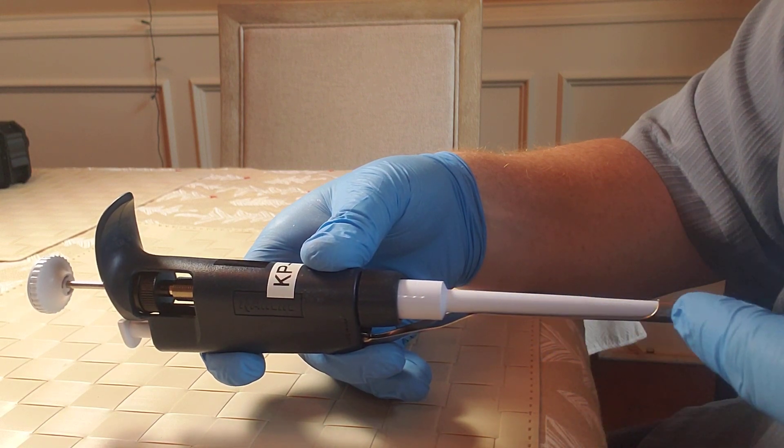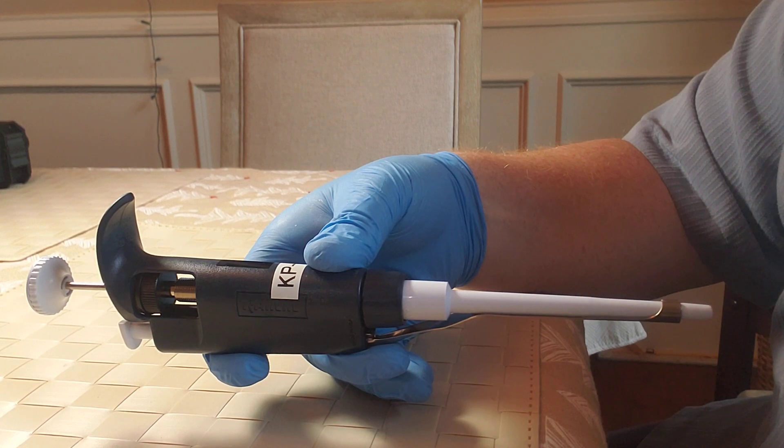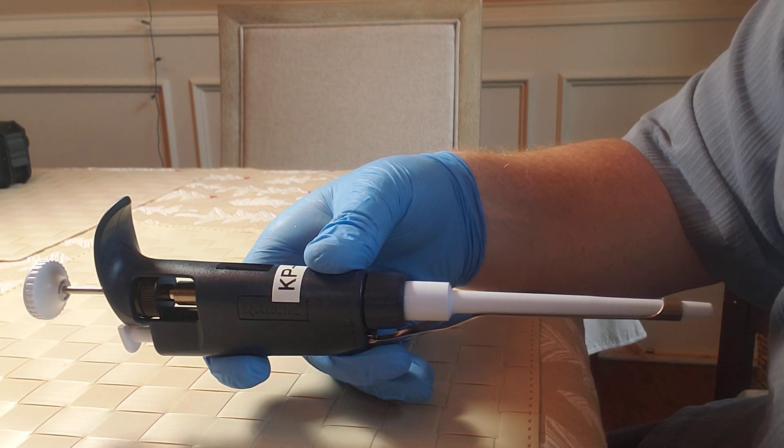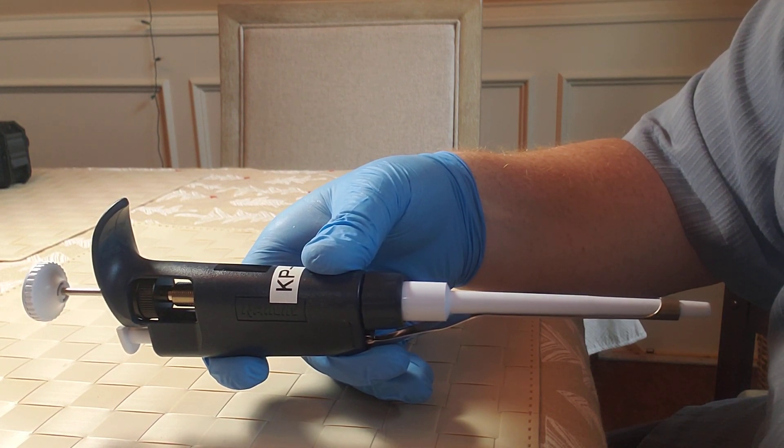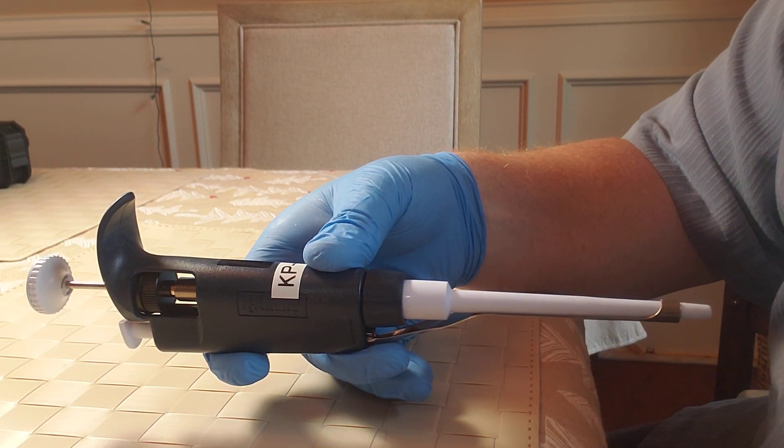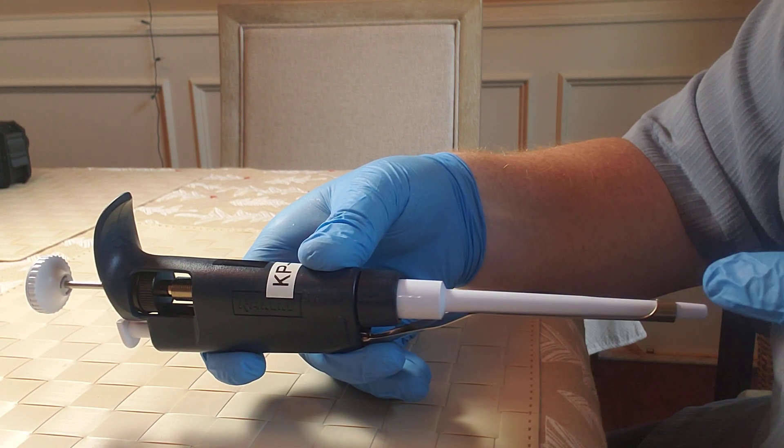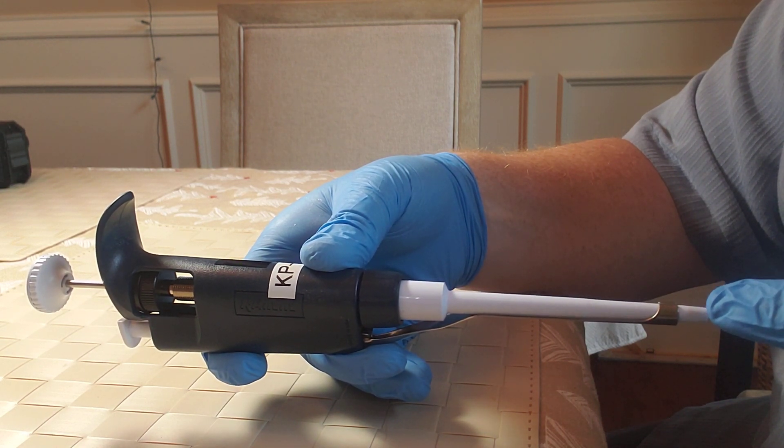Inside the white shaft as you see here, there are vital internal components such as, but not limited to, the seal, the o-ring, the piston, the shaft, springs, seal retainers, lubricant, and externally the pipette tip that goes onto the shaft.